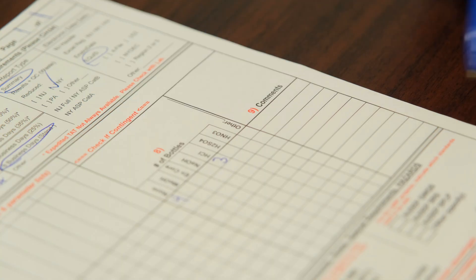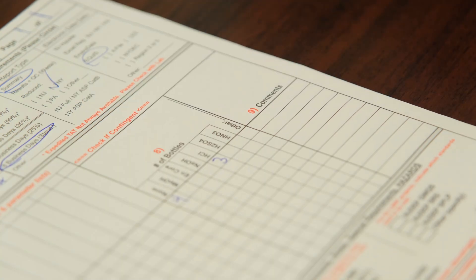And then if you have any comments on the sample itself — let's say for some reason you didn't collect enough volume — you could tell them to use this bottle instead for this analysis. In this case we're going to leave that blank.